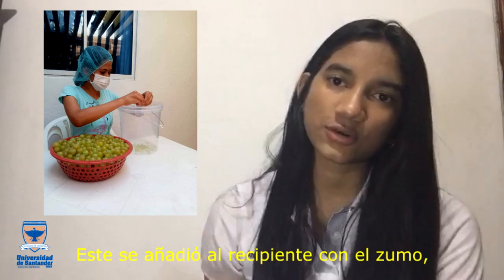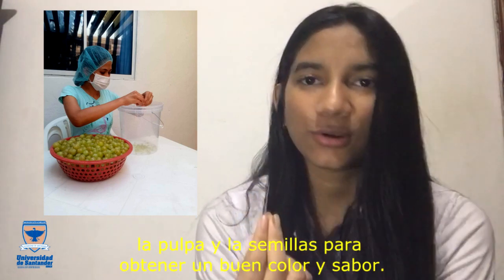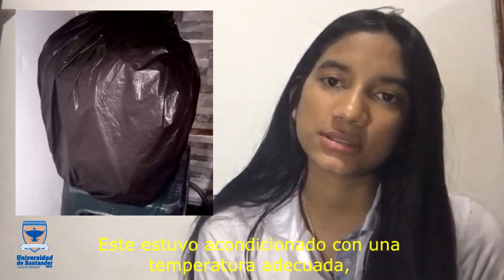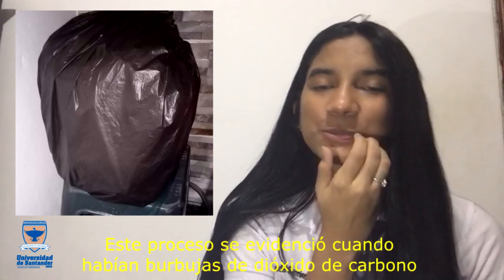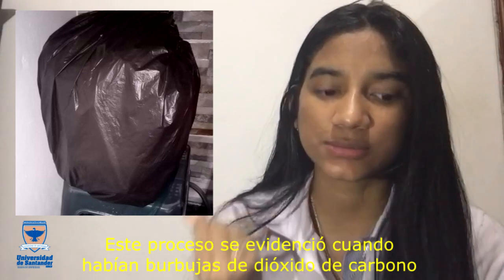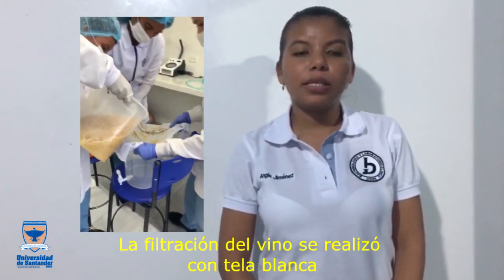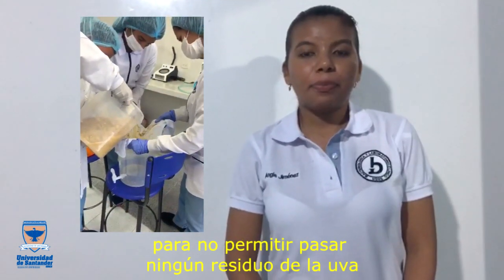This was added to the container with the juice, pulp, and seeds to obtain a good color and a good flavor. Okay, the fermentation starts with the covered container. This was conditioned at a stable temperature, approximately 30 degrees centigrade. This process was evident when there were carbon dioxide bubbles in the container. Then the filtration of the wine was done with a cloth, allowing no residue from the grape to pass.